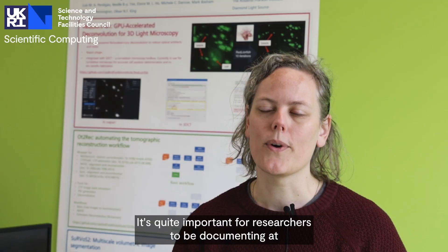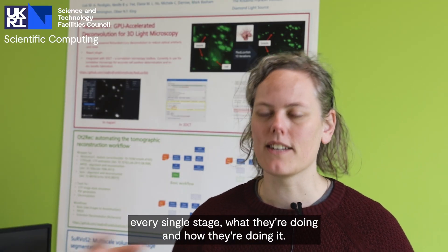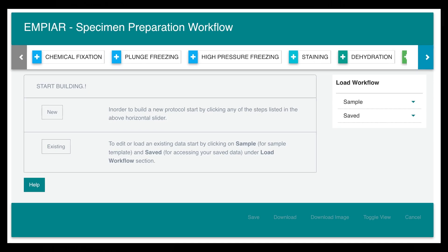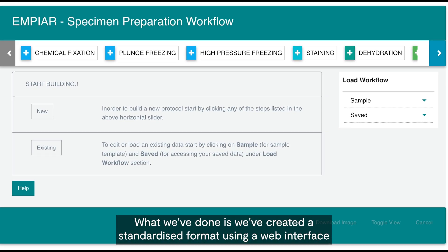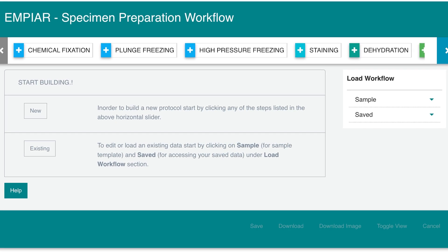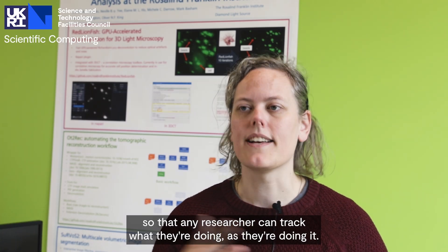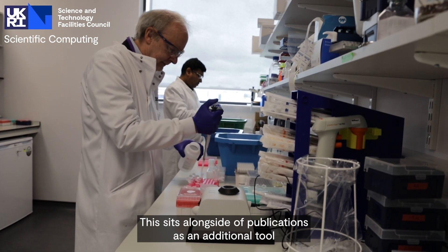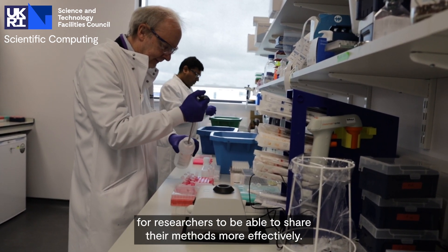It's quite important for researchers to be documenting at every single stage what they're doing and how they're doing it. What we've done is we've created a standardized format using a web interface, so that any researcher can track what they're doing as they're doing it. This sits alongside publications as an additional tool for researchers to be able to share their methods more effectively.